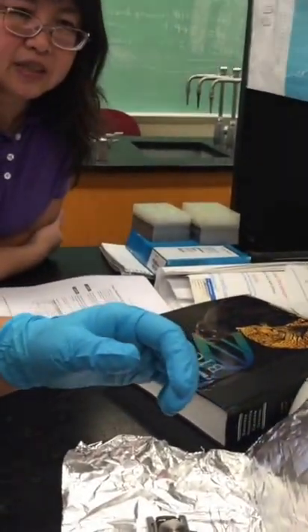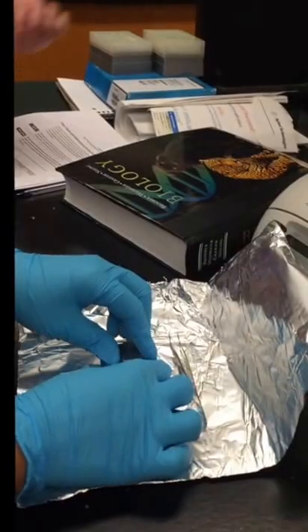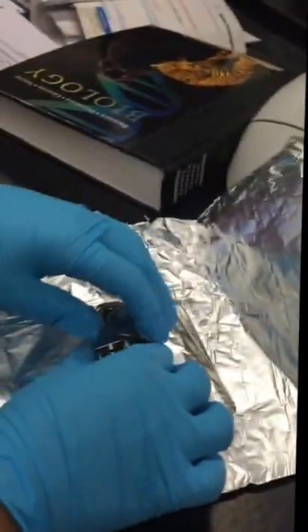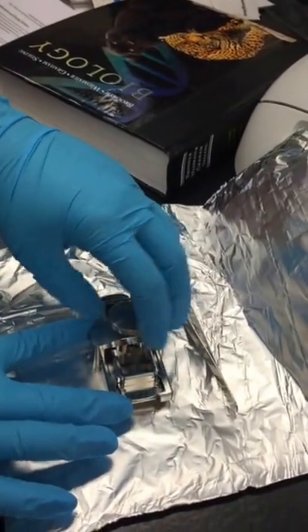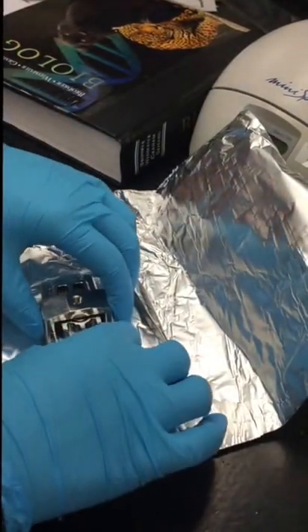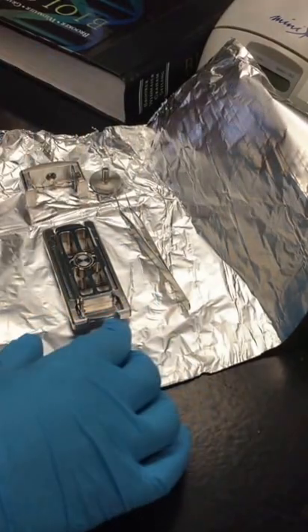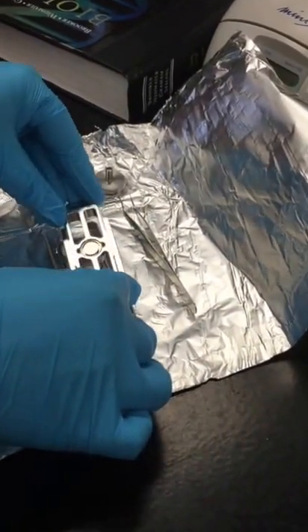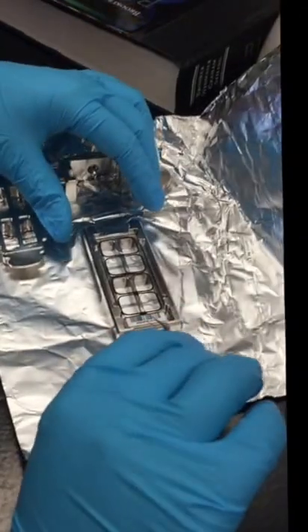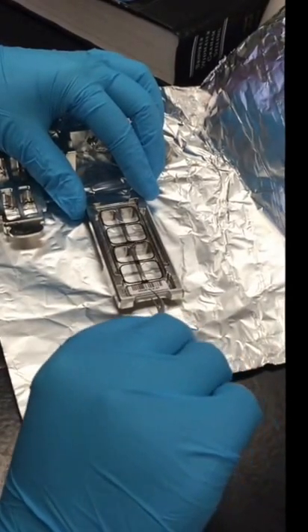The chip is out of the oven. When you take it out, the clamp is just holding the chips together, and then you want to use the forceps to take out both of them. You don't want to undo it on the clamp — you will undo it in the tube, unless it comes off easily.